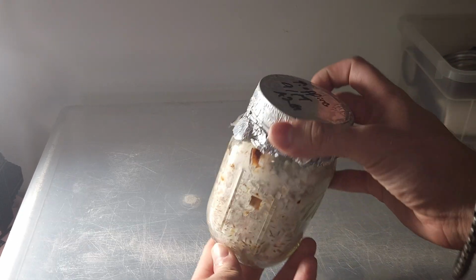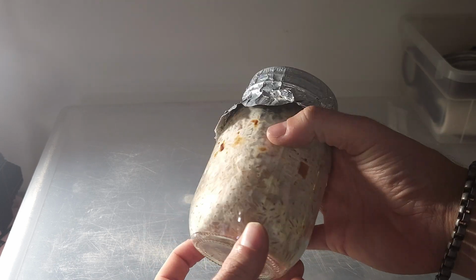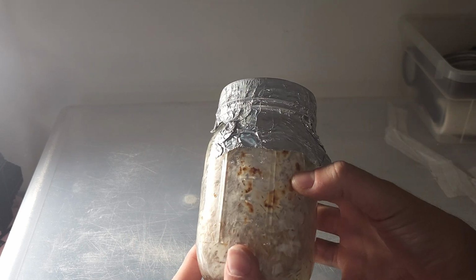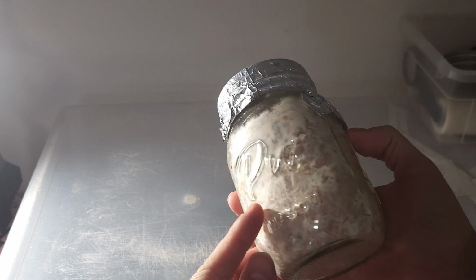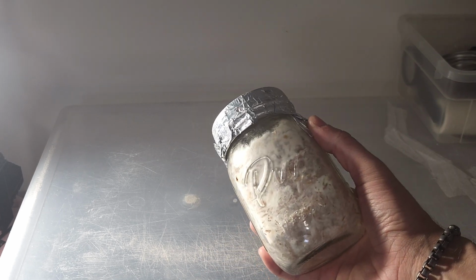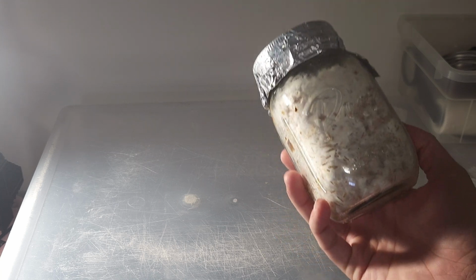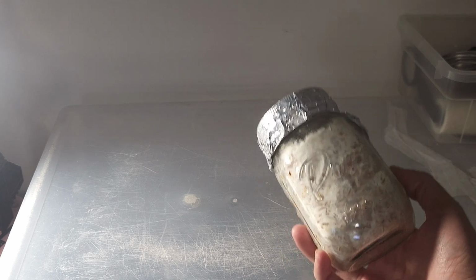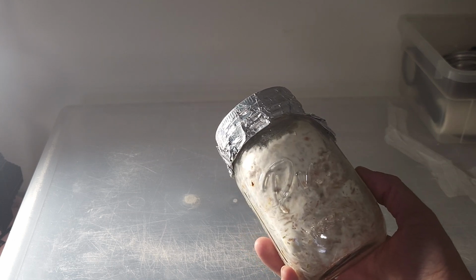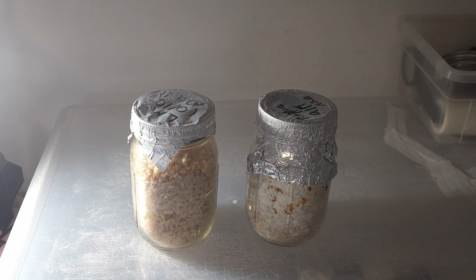Likewise, we have this Pioppino colonizing beautifully. Even with these discolored agar spots, everything in here is very healthy with no contamination. This is what you want to see in your jars. The secret here was proper grain hydration, correct sterilization procedures, and maintaining a clean working environment. Both of these jars were treated with that same care as mentioned earlier, and we got wonderful results.